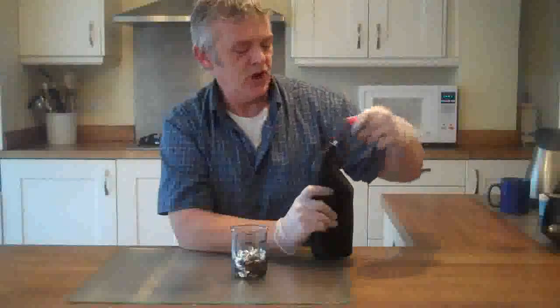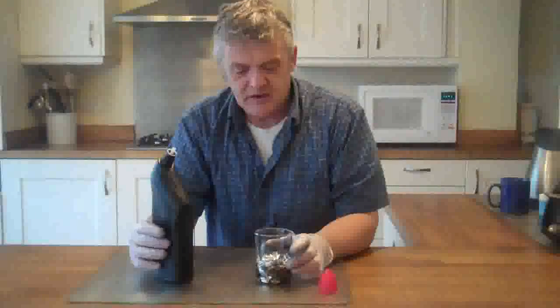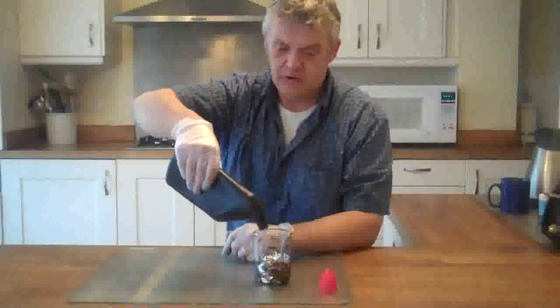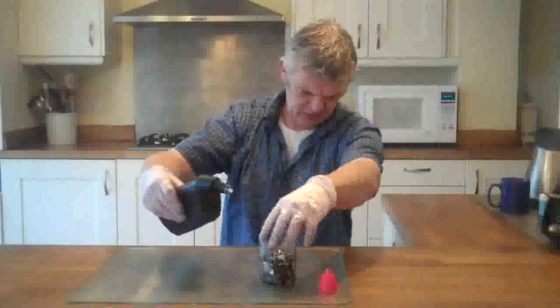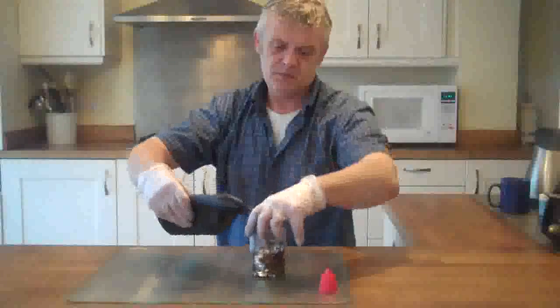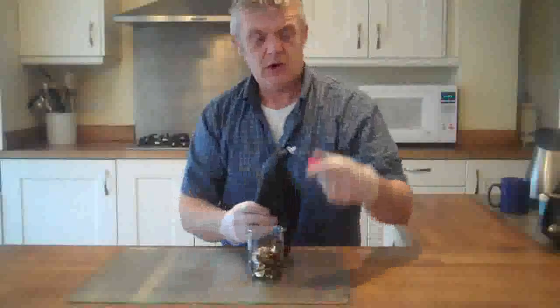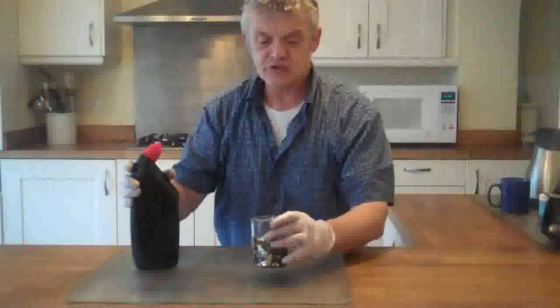I sound like I'm running a Blue Peter show. So, 10% — you just get normal 35% and add enough water to make it 10%. And you just add another 50 mils here. There we go — another 50 mils of your hydrochloric acid.